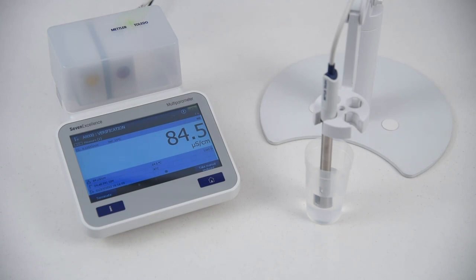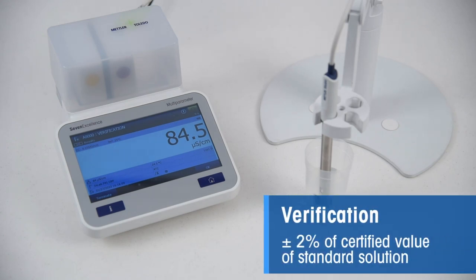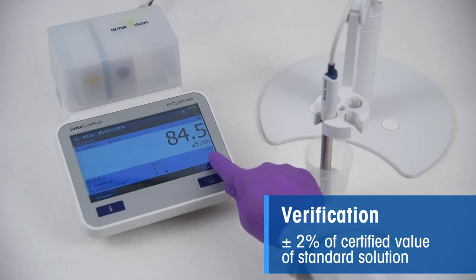Measure the conductivity of the standard and compare it with its certified value. If the measured value is within plus or minus 2% of the certified value of the standard solution, then the verification is successful and the sensor can be used.